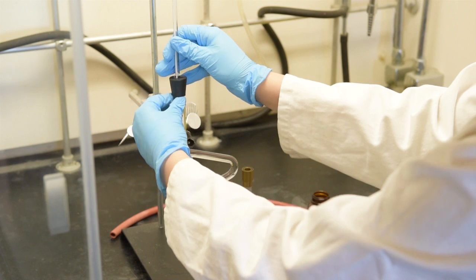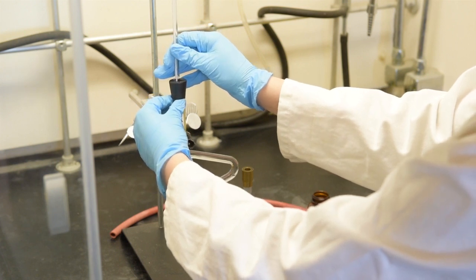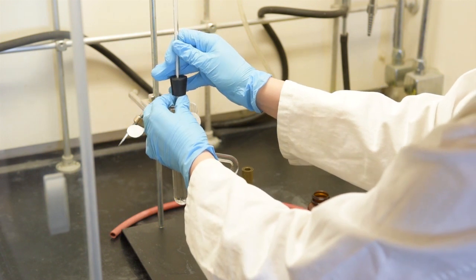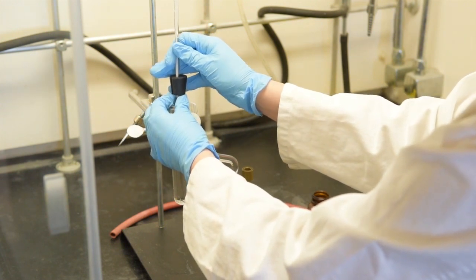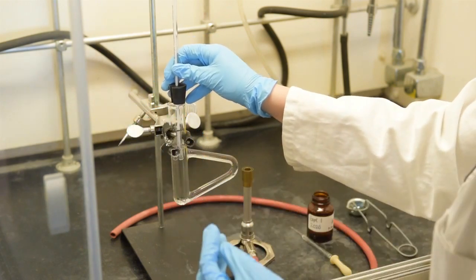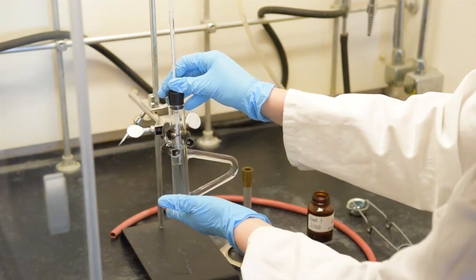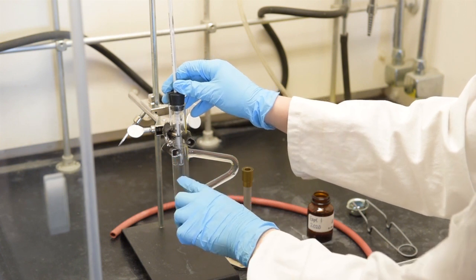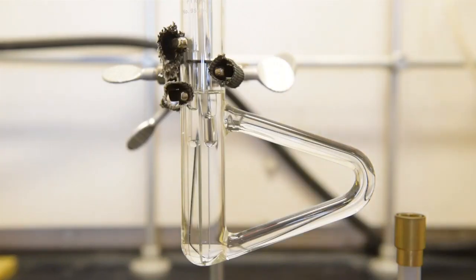This will take some fiddling. If the hot oil touches the rubber O-ring, it could cause it to snap, which would then make your test tube drop, and this could damage the equipment. So now the liquid is completely submerged in the oil, but the oil is not touching the rubber O-ring. The setup is now finished, and you may begin the boiling point determination.